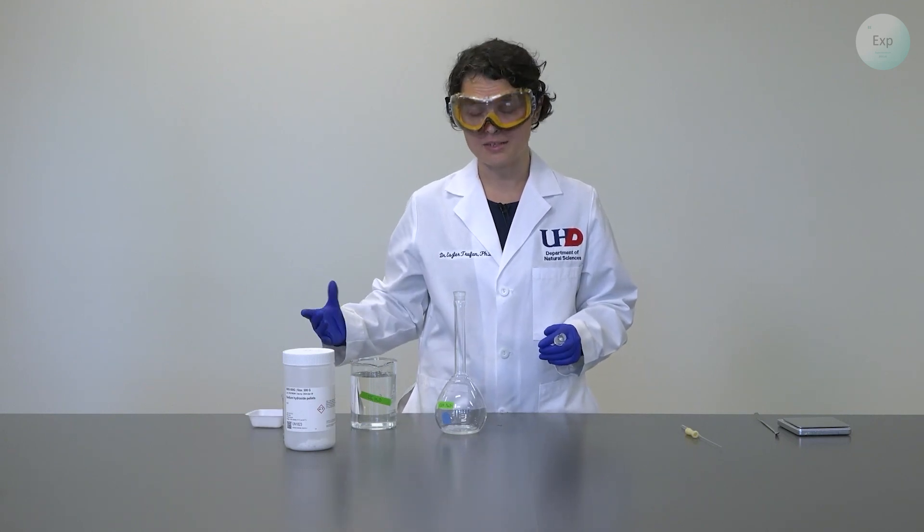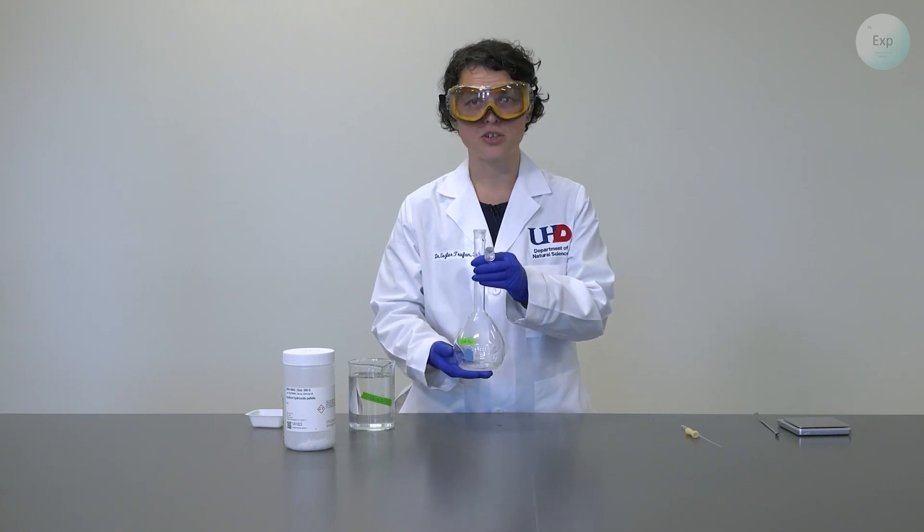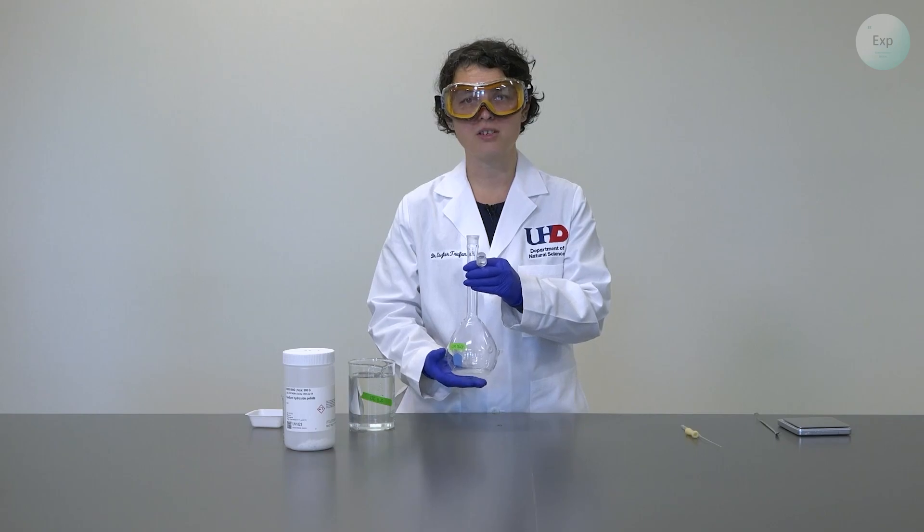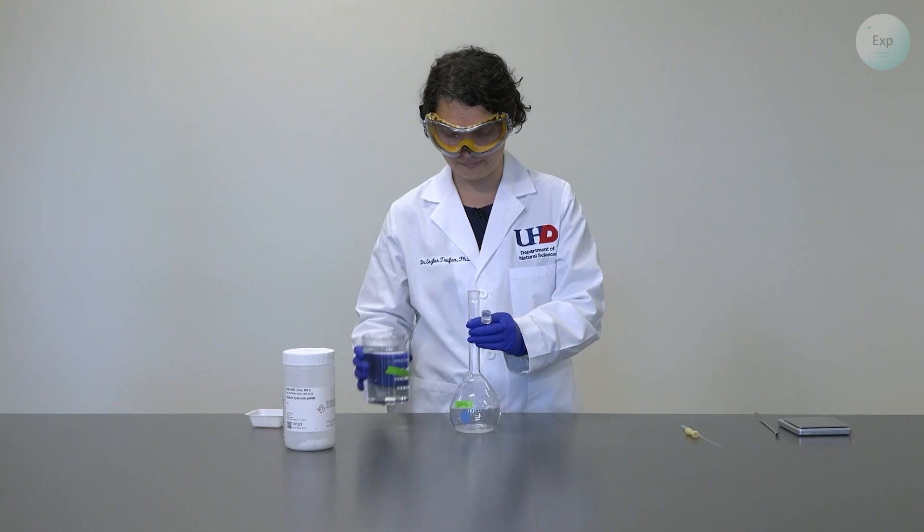If it wasn't, I could do another rinse. Next, I can also check on the temperature. And when I have a very small amount of water with the sodium hydroxide, it warms up a little bit. If we add more water, it will cool back down to room temperature.